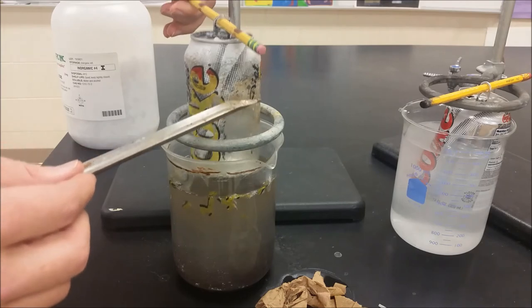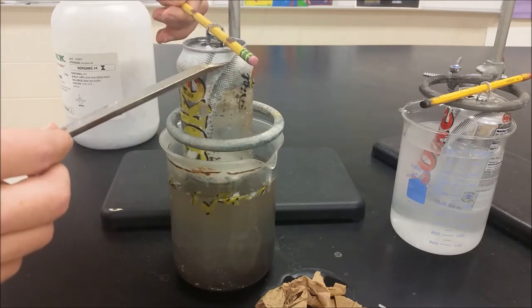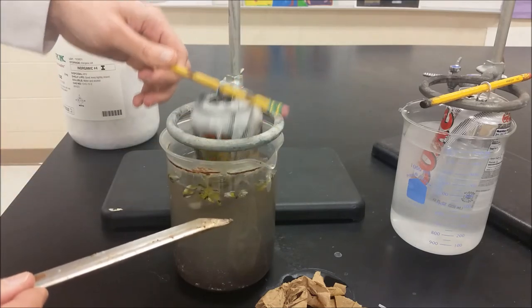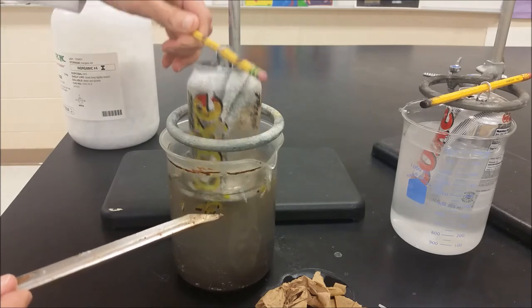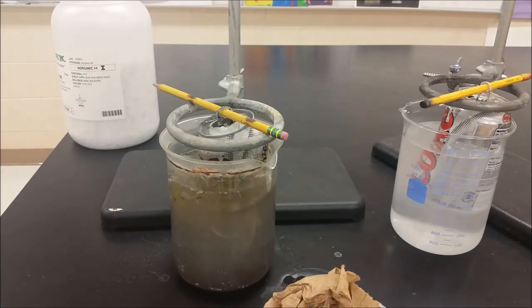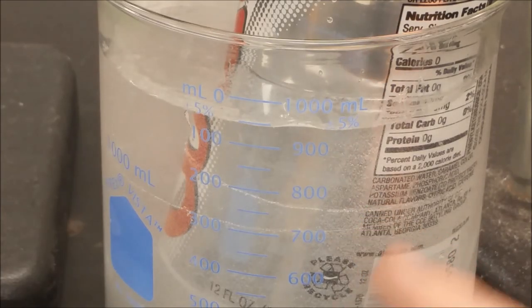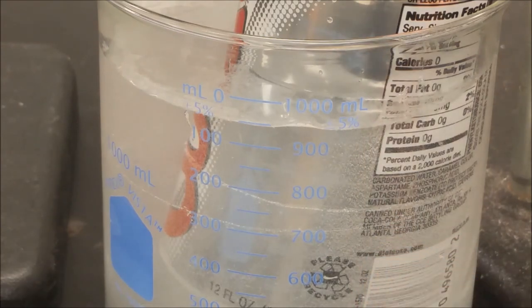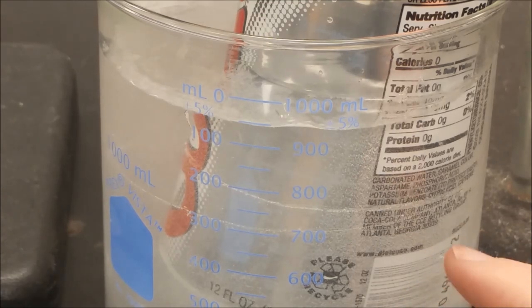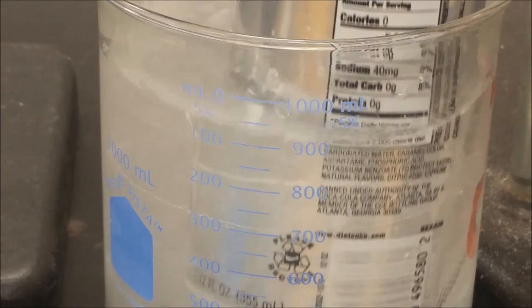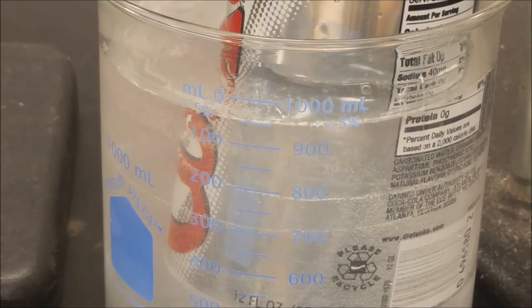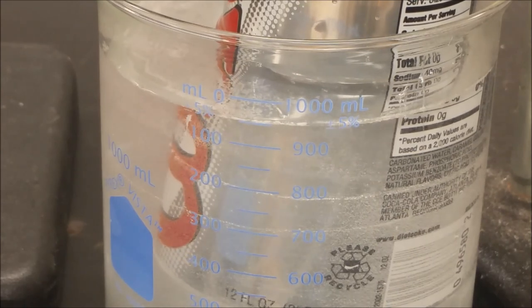The entire aluminum has been corroded away except for right near here where it's a little thicker and at the bottom where it's a little thicker. So we can see here this bubbling happening as the aluminum is actually undergoing a redox reaction in the hydroxide solution, and that takes some time to actually get to the point where enough of the aluminum is gone that we can see it kind of no longer have that shell when we get to the point where it's just the plastic underneath or at the top.